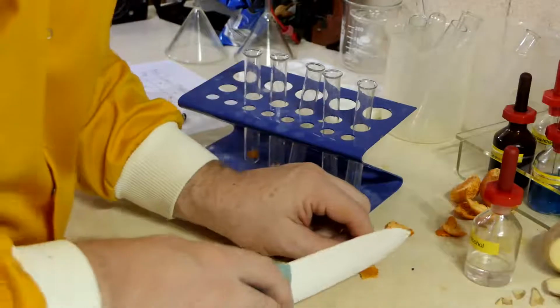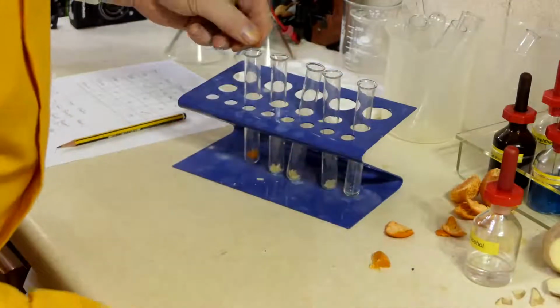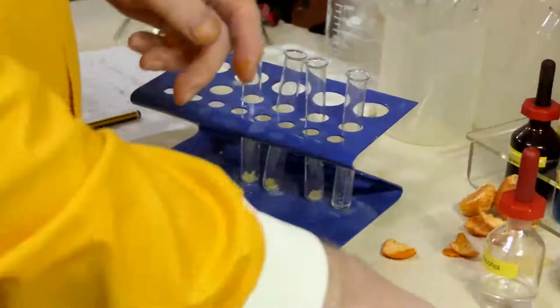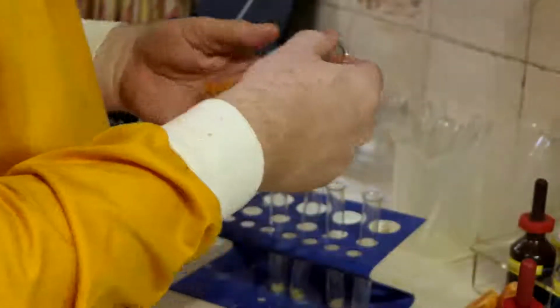I'm simply trying to break all this up so we can get the stuff reacting.